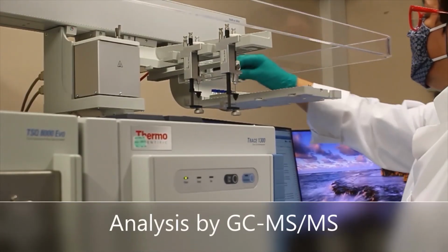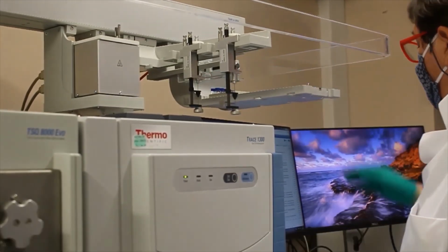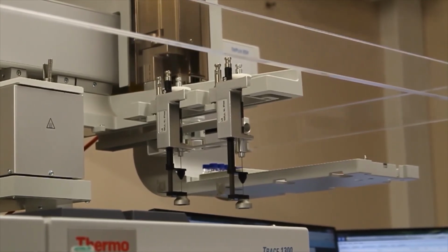All the data required is transferred to the evaluation software and combined with the concentrations measured on the instrument.